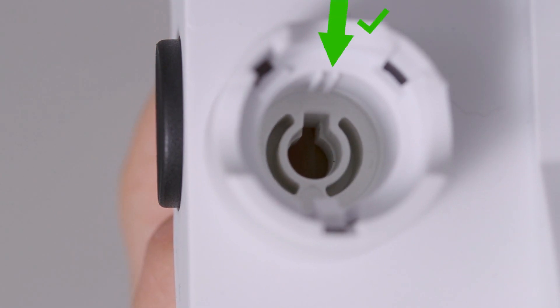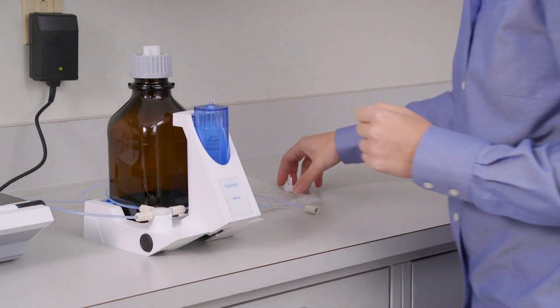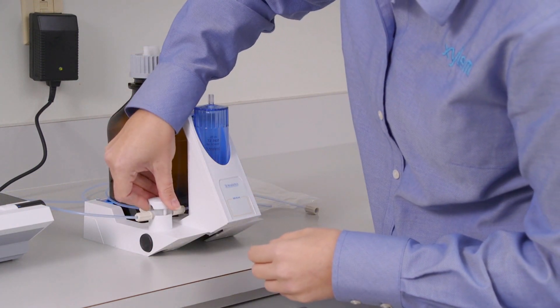And then you can take your valve cover and just snap it on top.